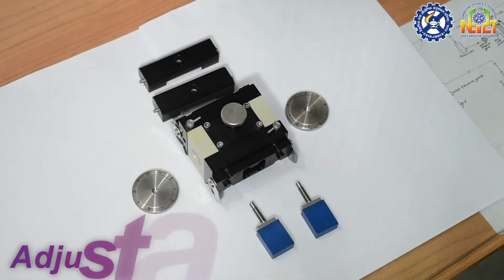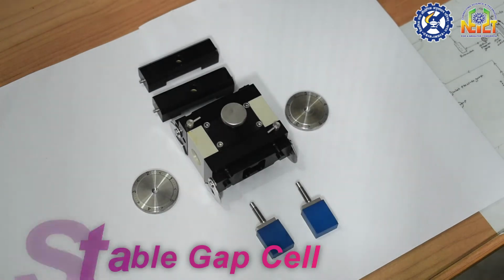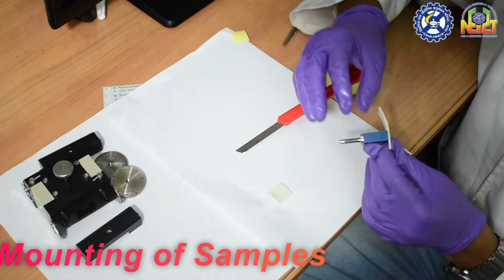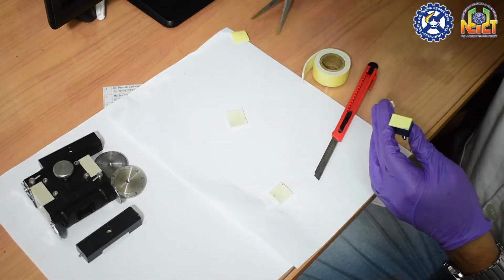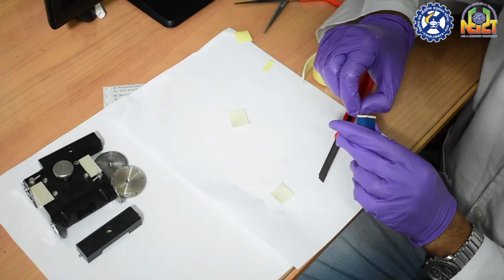This is the surface adjustable gap cell, which can accommodate small rectangular pieces of planar samples. There are two sample holders with the adjustable gap cell. We can use double-sided tape to mount the samples on the adjustable gap cell sample holder.